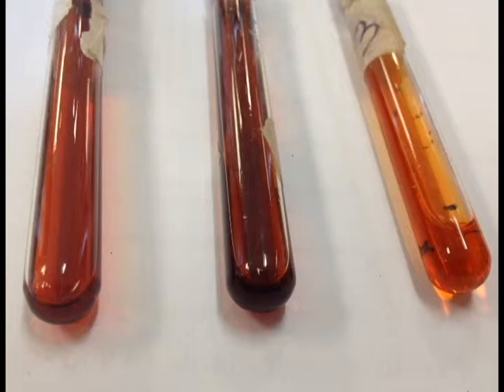However, when we added the thiocyanate, the clear liquid used up the iron solution when making more red, and we reduced the yellow and made more red, making a deeper red color.